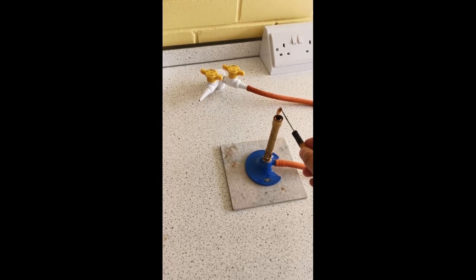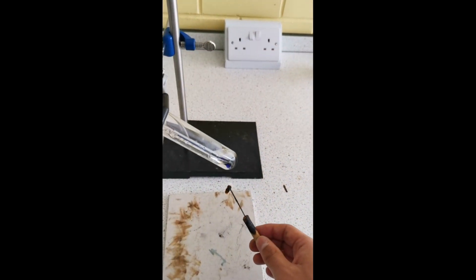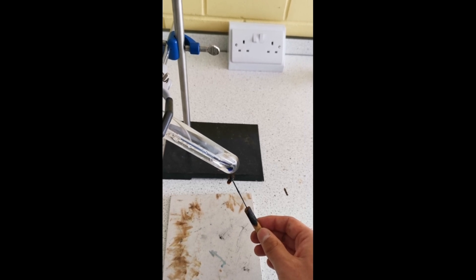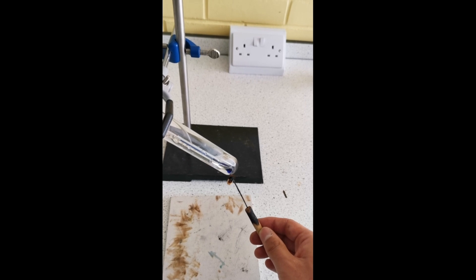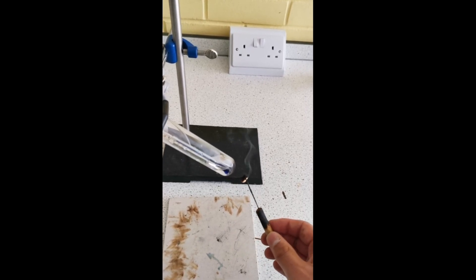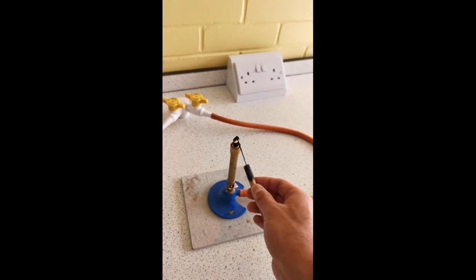Make sure the food is on fire. There we go. And you want to heat the water in the boiling tube using that flame. If it goes out before all of the food is used, you can relight it with the Bunsen burner.